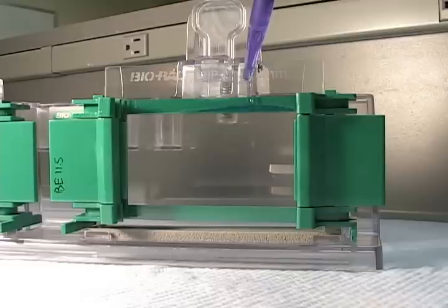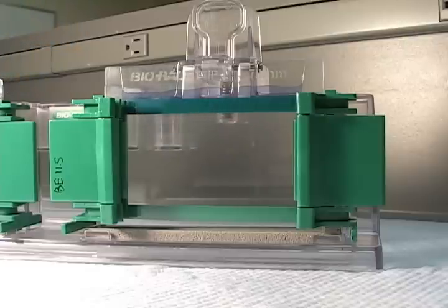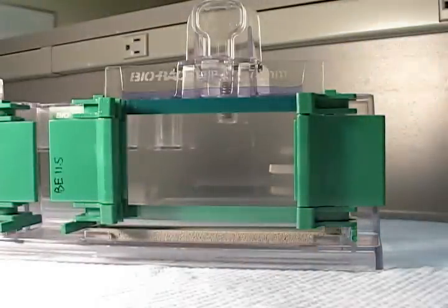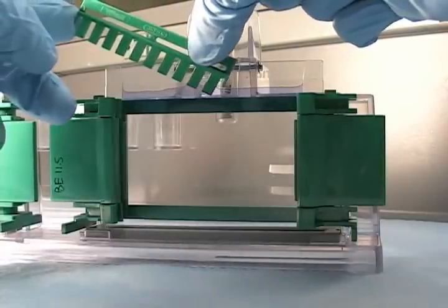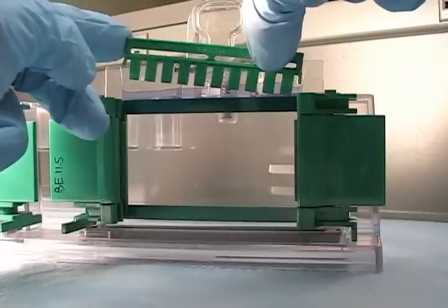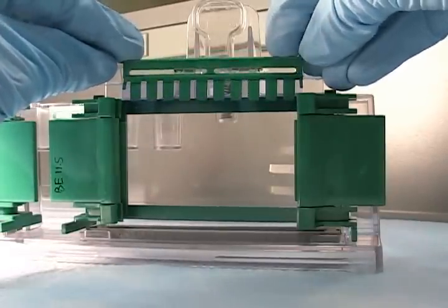I need to leave a little bit of room for the comb. Also as before, I'm going to seal this up and set it aside so I can tell when the gel is done. To insert the comb — this one is pretty lucky, there are no bubbles. If there were bubbles, I would try and sweep them to the side like this as I'm moving in, and then gently push the comb in so it fits firmly.